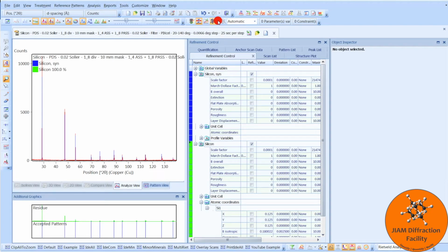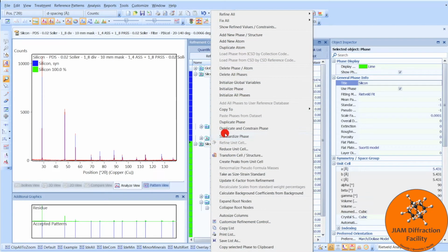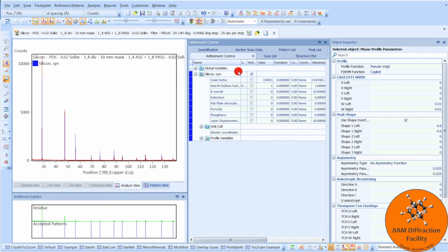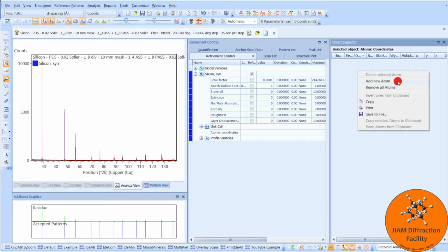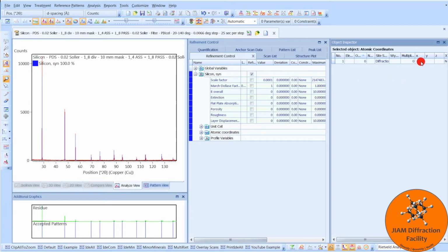Maybe you can't find a CIF file from somewhere that has the atomic coordinate information in it. Let's delete this file, or this phase, because we are done with it. And let's look back at the silicon phase that does not have atomic coordinates. So left click here, and we want to right click here and add new atom. Now we see a row appear that we can start entering information into.